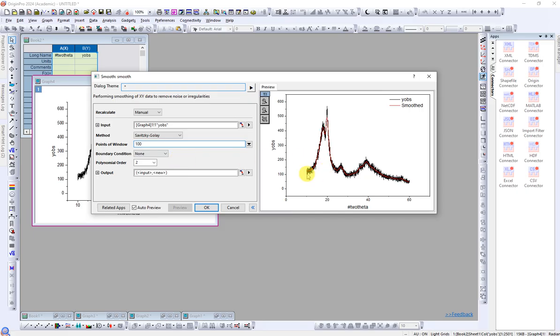Let's see how. Yeah, so from the value of 100 you can see the peaks are pretty smooth and exactly on this peak, and also on this peak, also exactly on this peak, and all other peaks, they are exactly on top of each other. So it means 100 points of window is perfect to smooth this graph. So then you have to click OK, and then you will get data for the smooth graph.